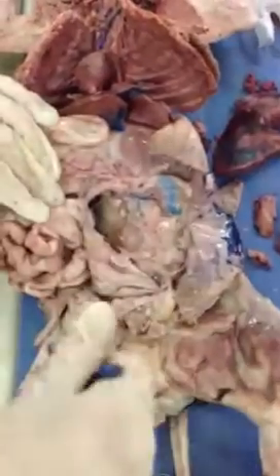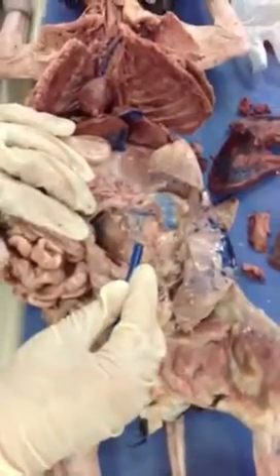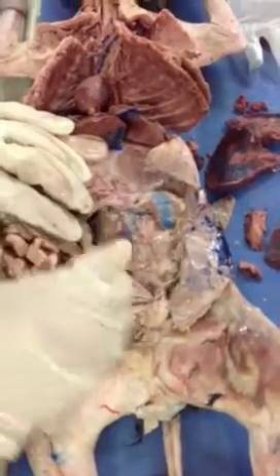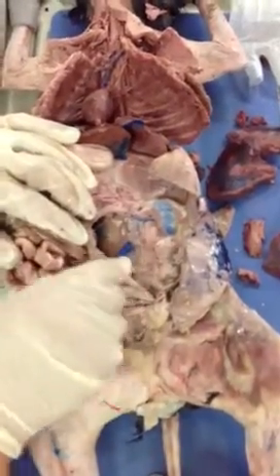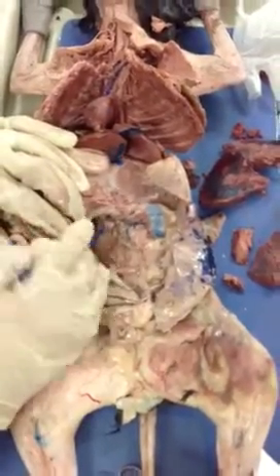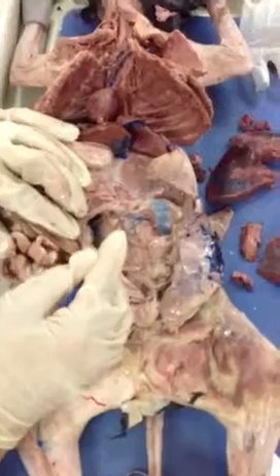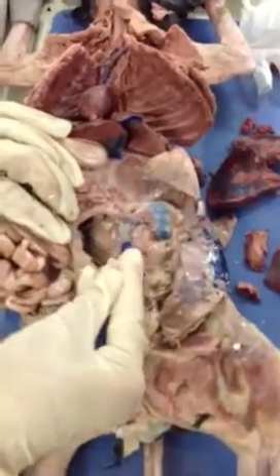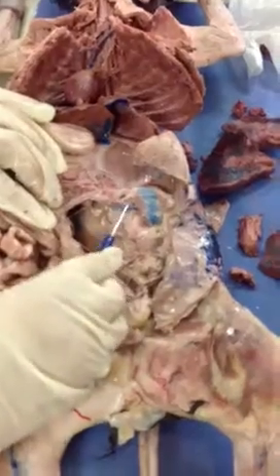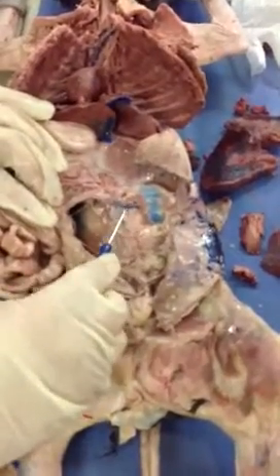Now, if you notice, here we see the vein, right? And here we see clearly the artery. You see? Each artery has a satellite vein that accompanies it. So if you're not sure, because the vein you can see better, immediately you see a vein, you know that an artery should be around it, right? So this is my renal artery and renal vein.